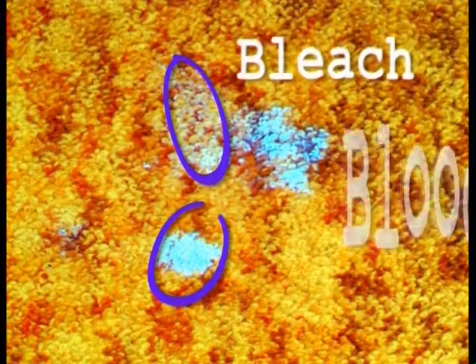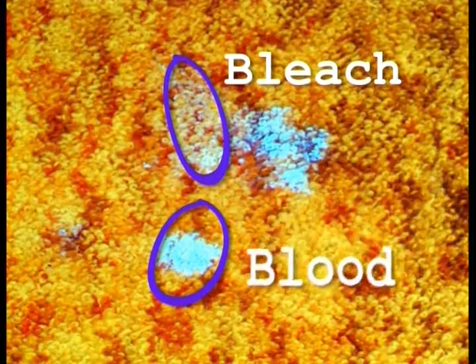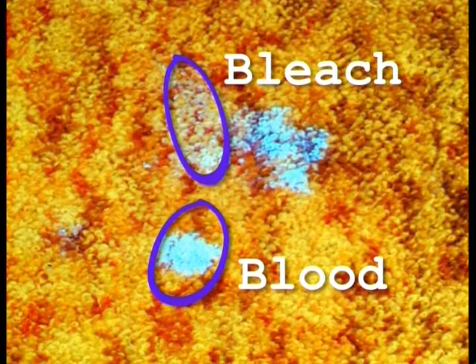As an anecdote, I have even had blood mixed with bleach on a carpet and been able to tell the difference between a reaction to bleach and the reaction to blood. So I only took a sample at the location where I believed there was blood. I blocked off all of the reaction areas which I believed were false positives for bleach. DNA was then found later during the DNA analysis.